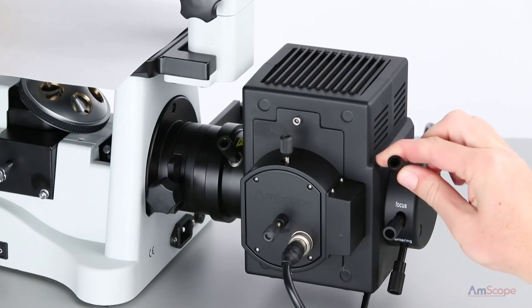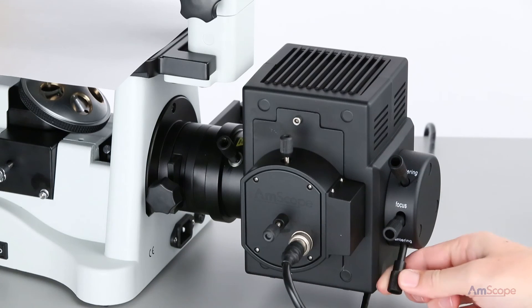The adjustment knobs on the rear of the lamp housing only affect the mirrored image. This can help you distinguish between the two light sources.